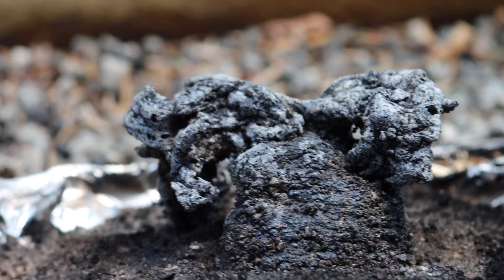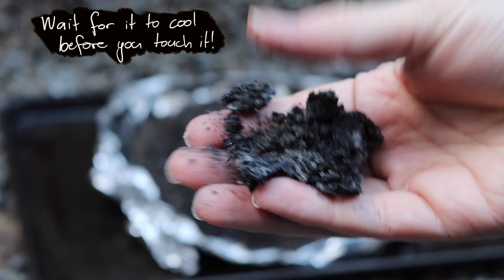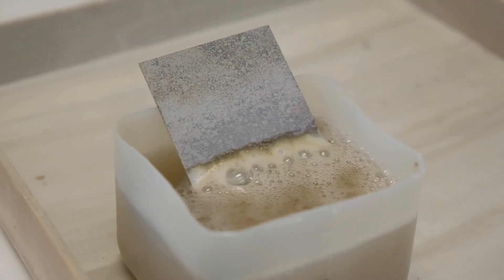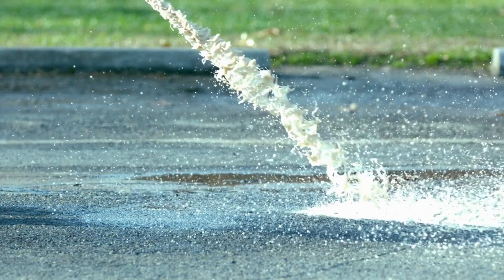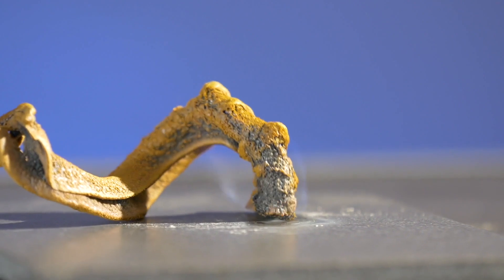The gases released you can't see, but you can see the effects they have — they push the solids upwards, which should give a snake effect, but just gave us a mound each time. The black substance is actually very light and not at all dense; it's mostly air. But it's still disappointing. I think sometimes when we hear 'science' we almost think 'magic trick' — I'm going to make something change or explode. And that is an element of science. It can be a spectacle, it can be fun. Other times it's less fun.